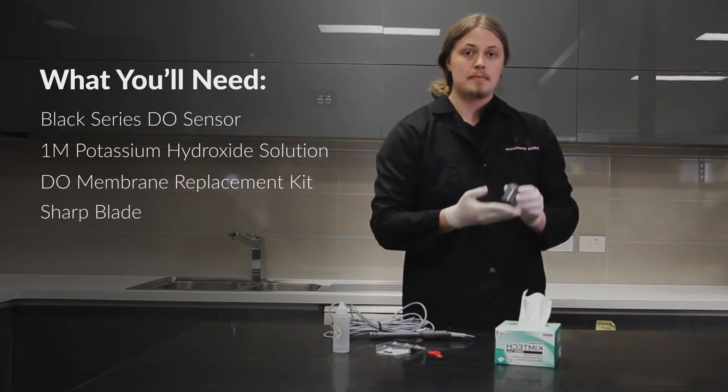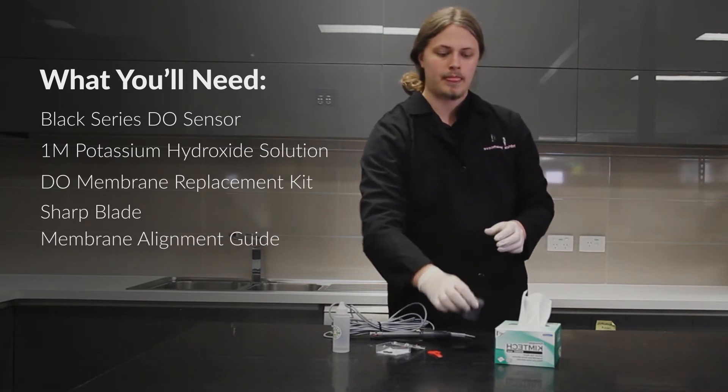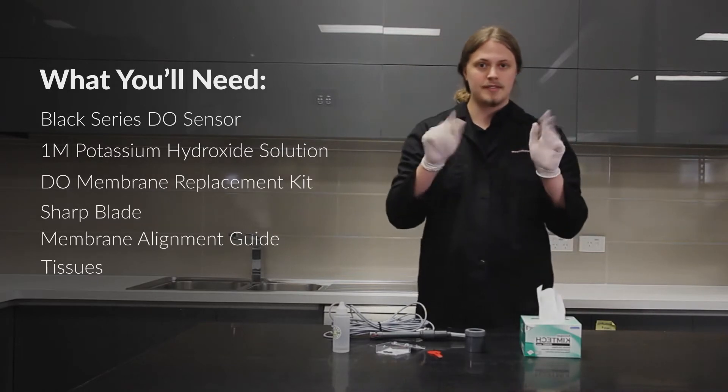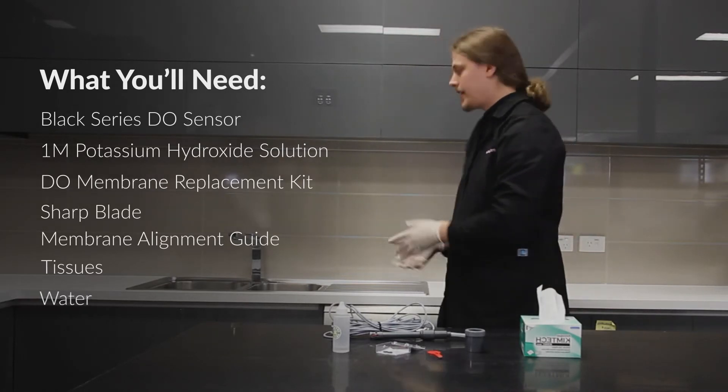You'll also need a membrane alignment guide and some tissues. It's recommended to wear gloves and do the entire process over a sink.